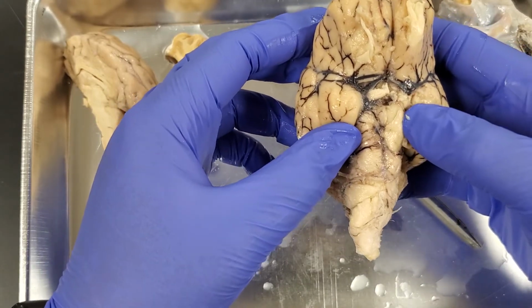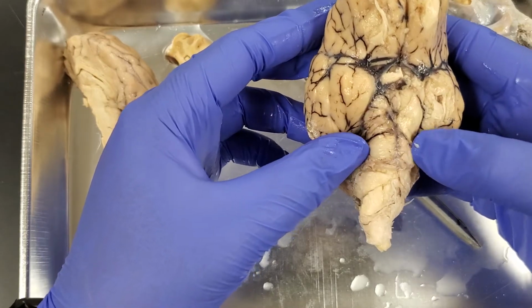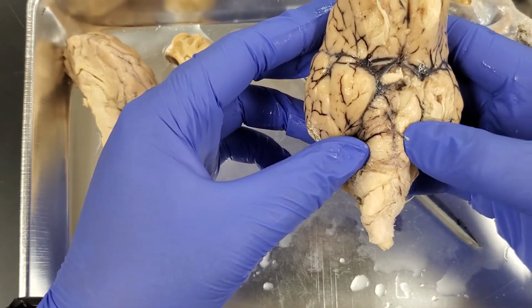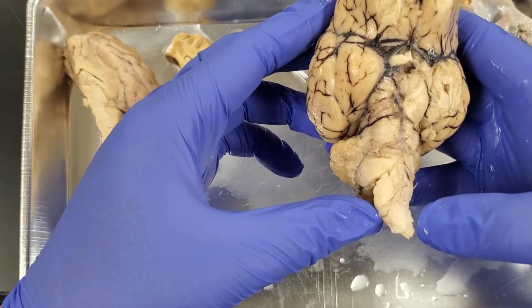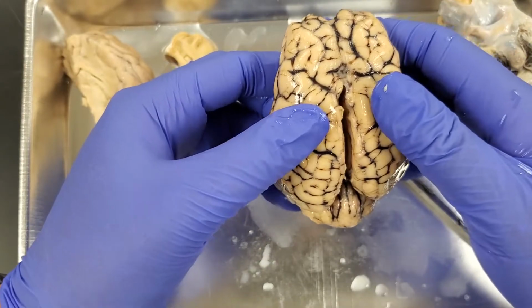We are then going to kind of move down. From our mammillary bodies, we're going to go down here. This is our pons, and then our pons is going to give rise to the medulla oblongata and then into the spinal cord itself. So I talked about pia mater, right?